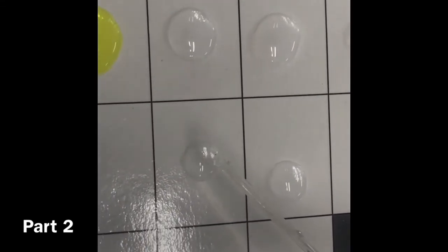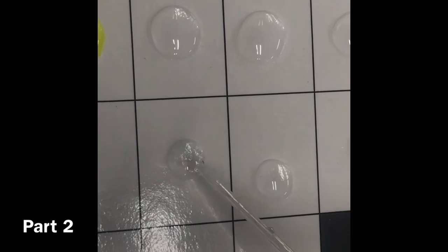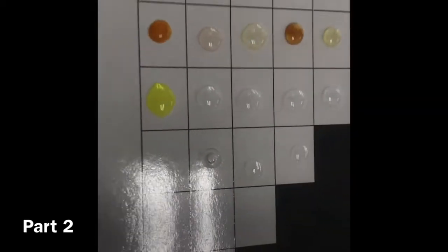Trying to give you an up-close view. Okay, these two are reacting. Oh no, it's lame. Nothing happened. It did nothing. Once again, nothing happened. Wait, is it looking a little cloudy, maybe? No, it's not. Not even kind of. Just my goggles.